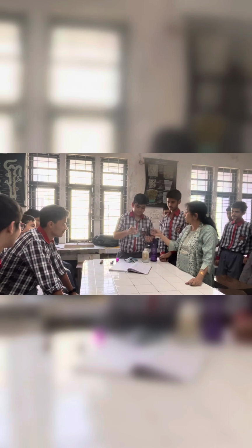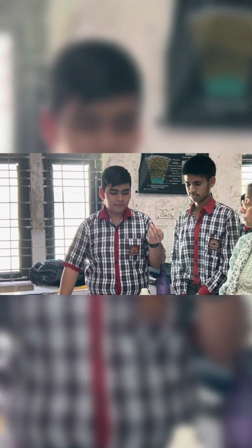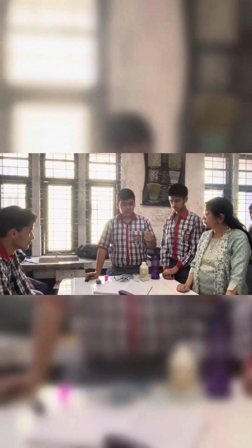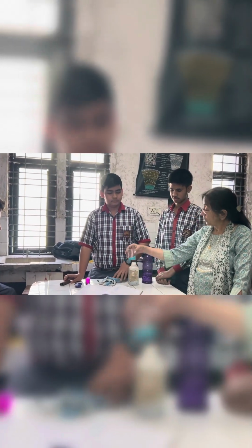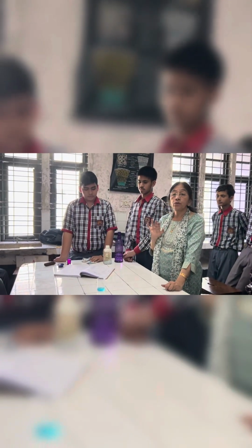Now we are going to be taking this nail, and we have removed the layer of rust from it using sandpaper. Now we are going to be adding this nail in the solution of copper sulfate. So we will keep this apparatus undisturbed for some time so that this reaction completes, because it is a slow reaction.